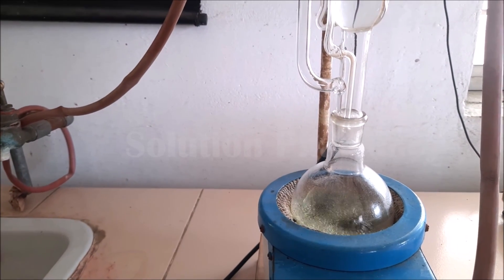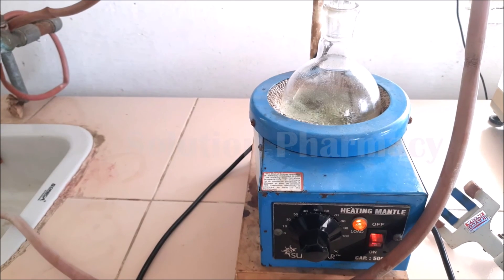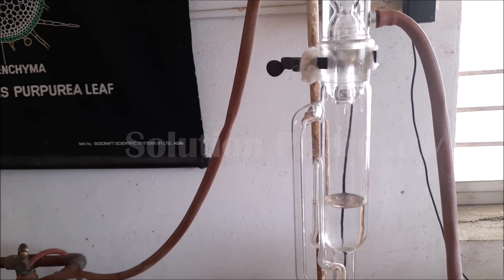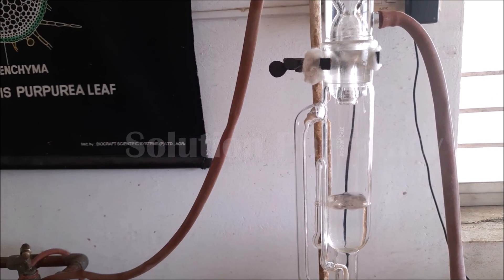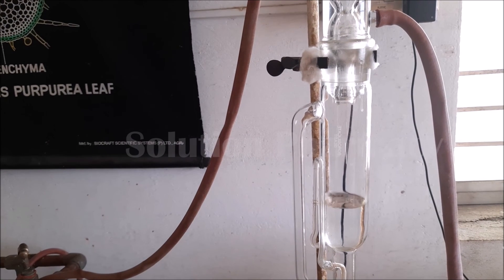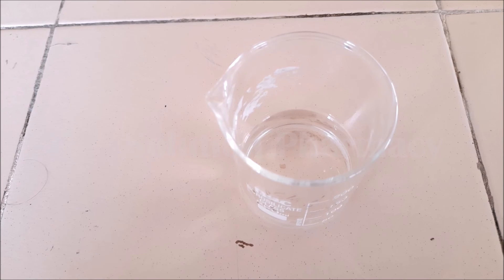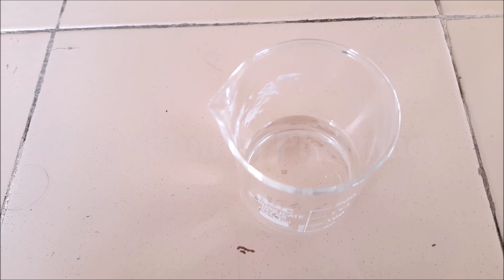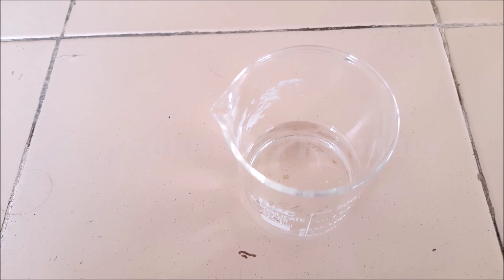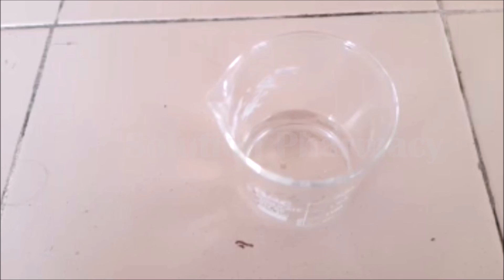The solvent from the liquid extract evaporates, condenses into liquid form in the condenser, and collects back into the Soxhlet extractor. We then collect this recovered solvent from the extractor. This is how we can recover the solvent from the liquid extract obtained after the Soxhlet extraction of the crude drug. Thank you very much for watching this video.